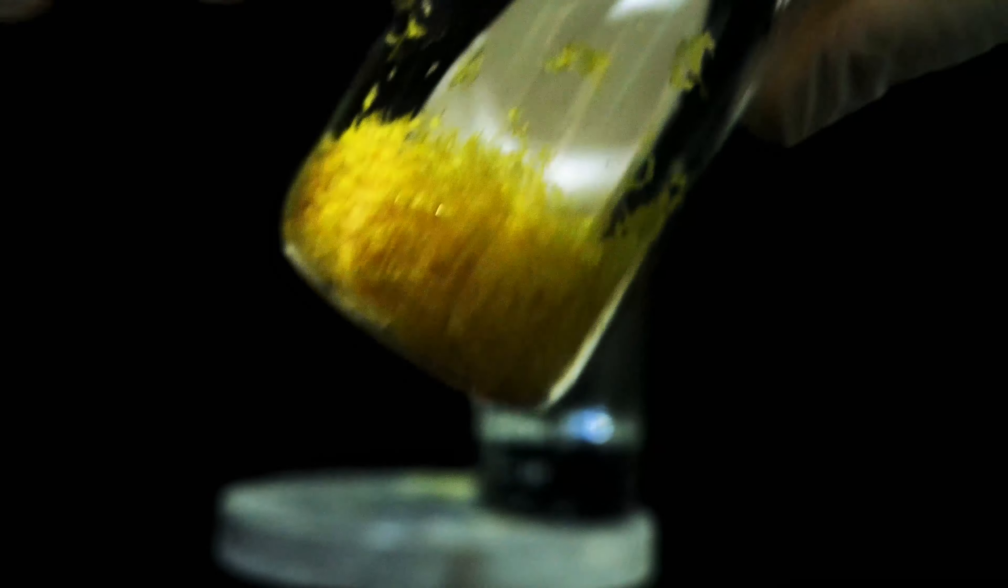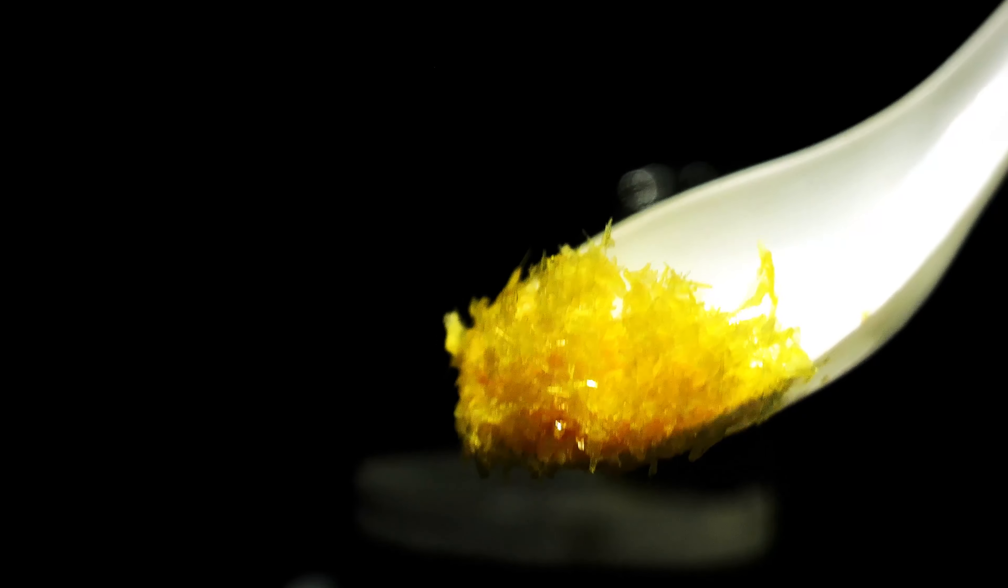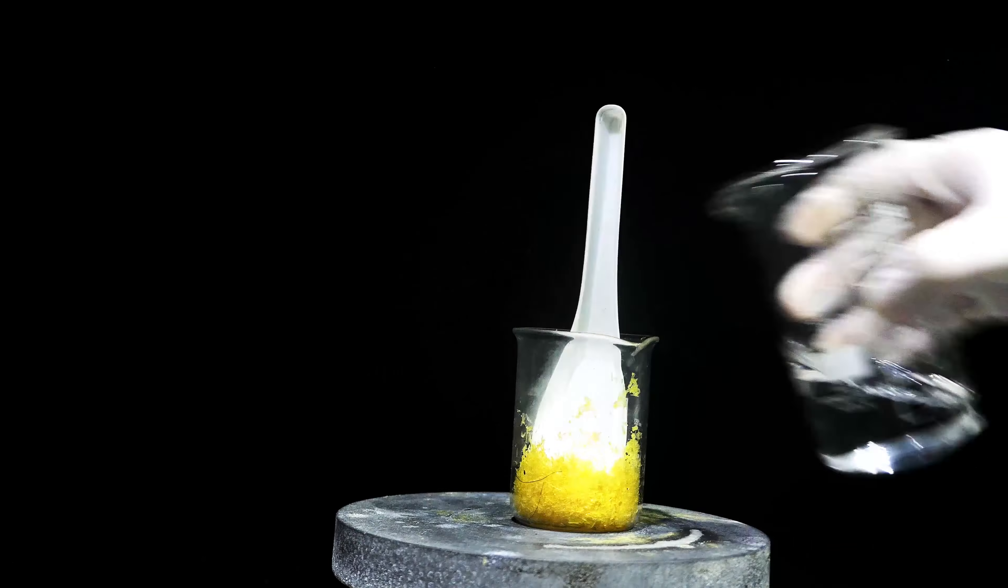which yields some yellow crystals. As the saying goes, yellow chemistry is bad, so I need to do a recrystallization.